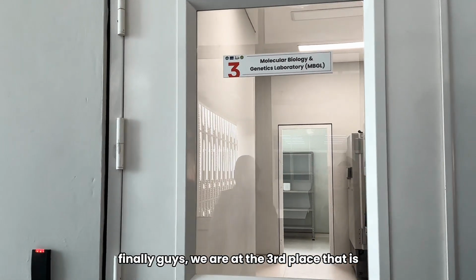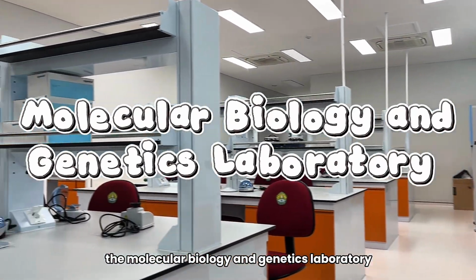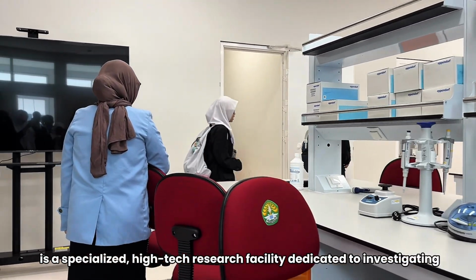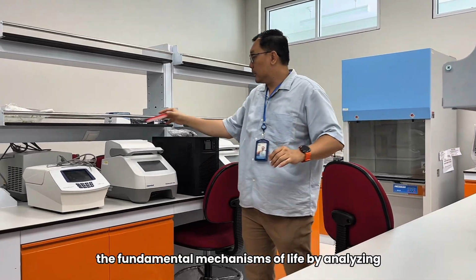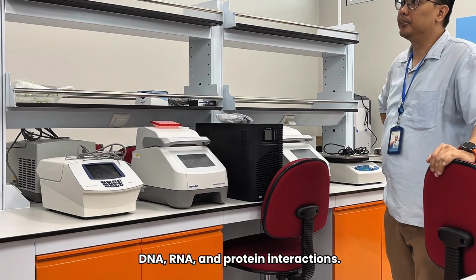Finally, guys, we are at the third place, the Molecular Biology and Genetics Laboratory. It is a specialized high-tech research facility dedicated to investigating the fundamental mechanisms of life by analyzing DNA, RNA, and protein interaction.